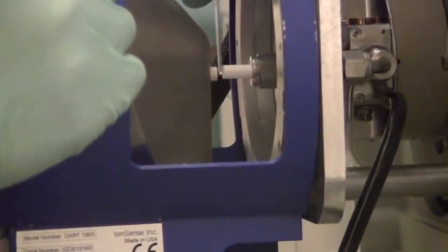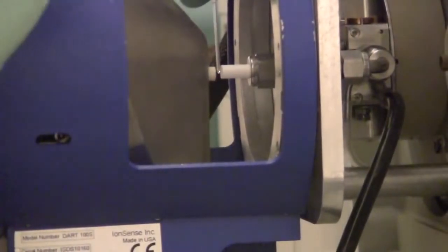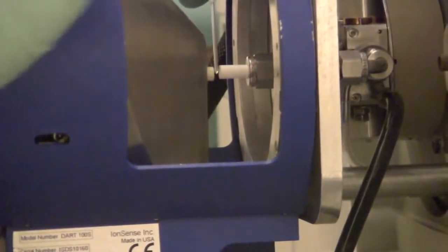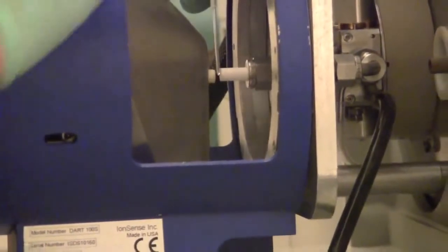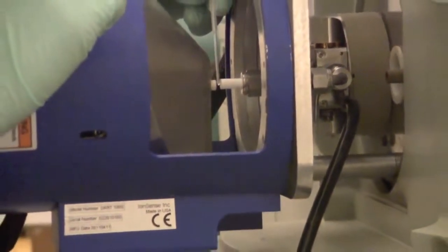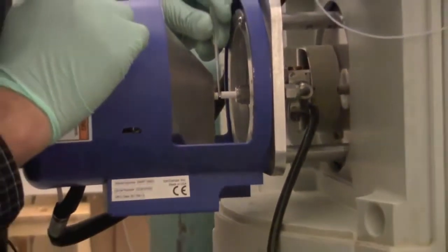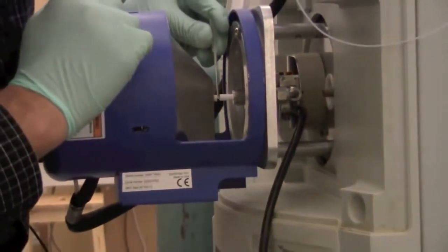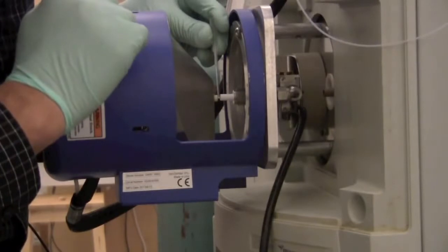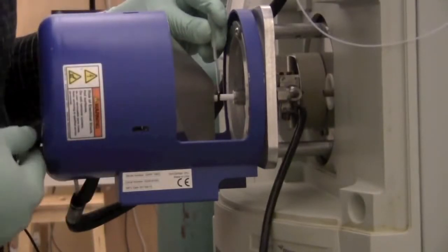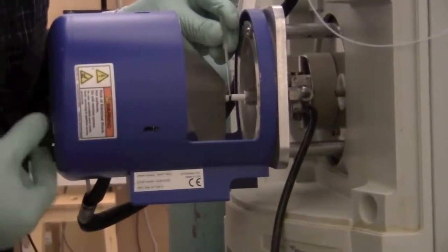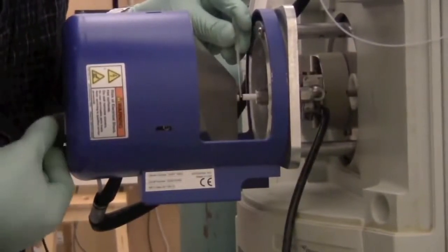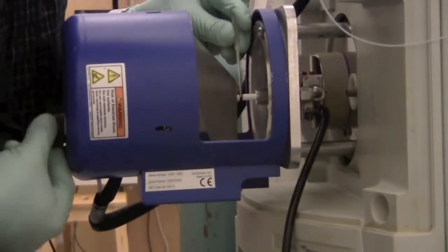And we can place the capillary into the space between the source and the inlet. This will heat the sample and the helium ions will hit the sample and ionize the sample and send it into the mass spectrometer. It's a good idea to try not to touch either the source or the inlet. We don't want it to be contaminated. If you want, there's a dial on the back here that can adjust the gap to accommodate a larger or smaller sample.